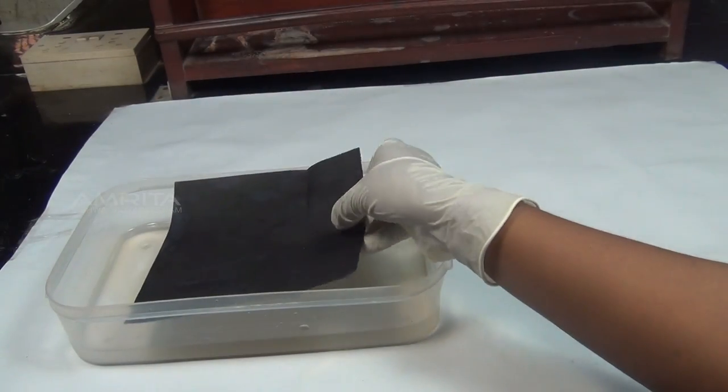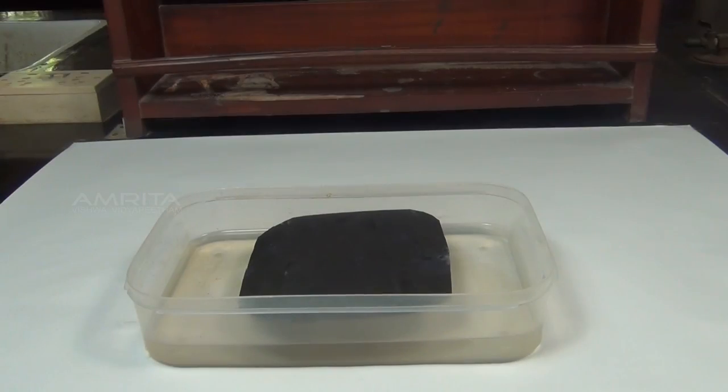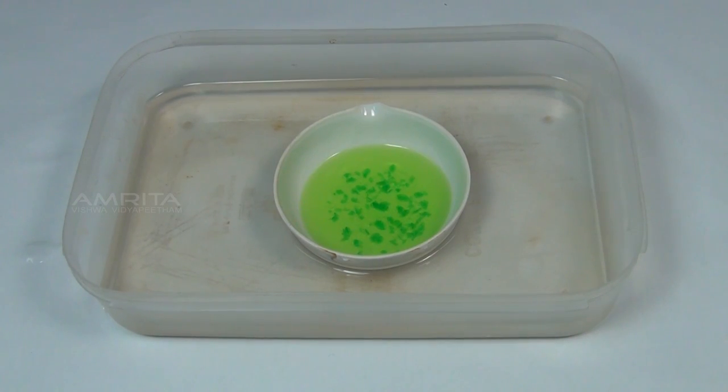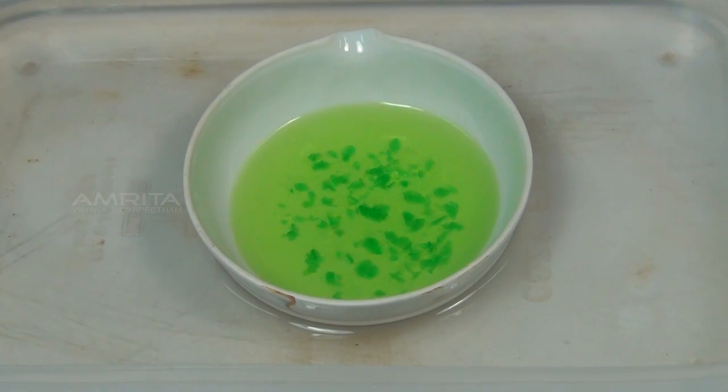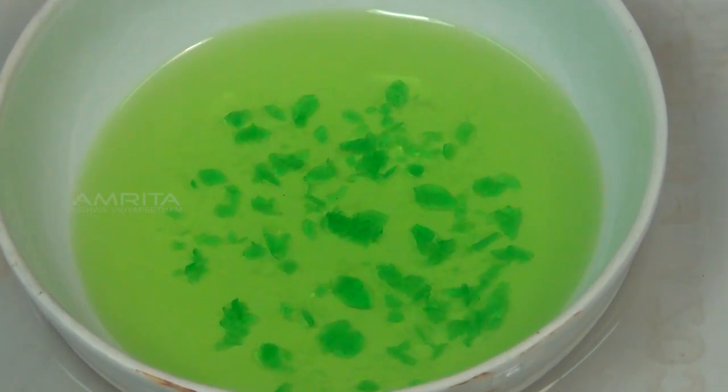Cover the dish with black paper and allow it to cool slowly for some time. On cooling, emerald green crystals of potassium trioxalatoferrate separate out.